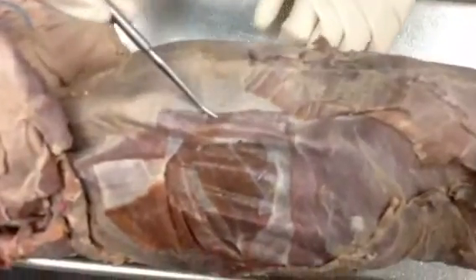And then in the abdominal region, it's harder to see on this one, but the muscle fibers that run cranial to caudal are the rectus abdominis muscles. So those would be similar to your abs. And then for the epaxial muscles, so all of these were the hypaxial muscles.